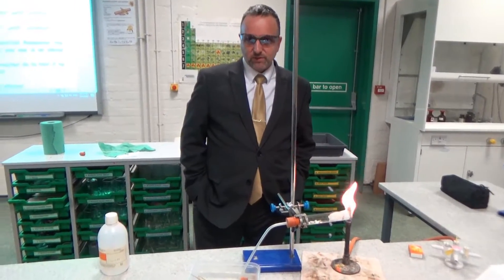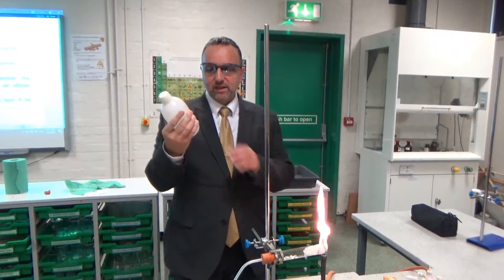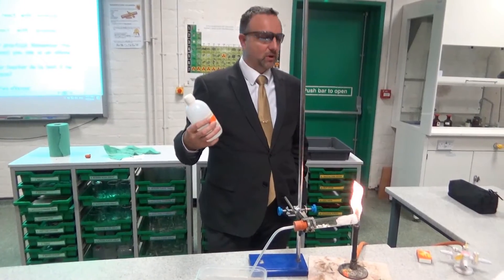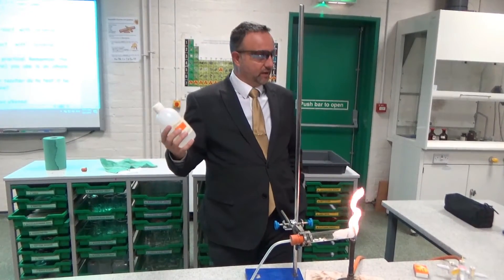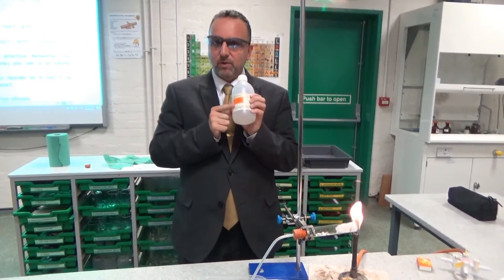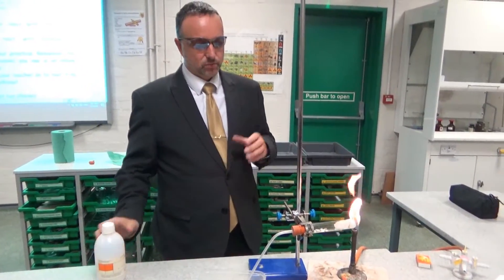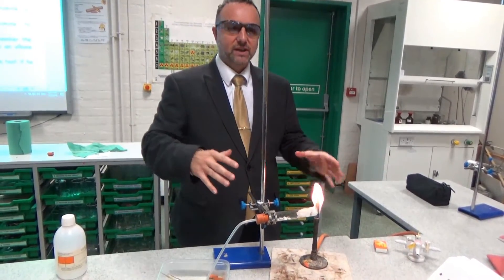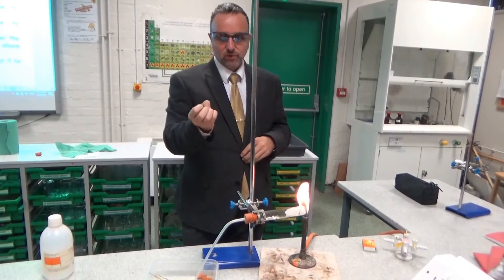Basically this is the process of cracking. Cracking is the process whereby you get molecules like paraffin and we break them into smaller molecules. Why is that useful? Well, in the average barrel of crude oil in the world there's not enough petrol to supply everybody's demand, but there's too much paraffin. So what we can do is break these bigger paraffin molecules into smaller molecules — petrol. Some clever scientists figured out we could do this with a process called cracking. What you can see here is basically a laboratory version of it. In industry they have huge vessels for this continuous process, but this is just a quick batch process we can do in a lab.